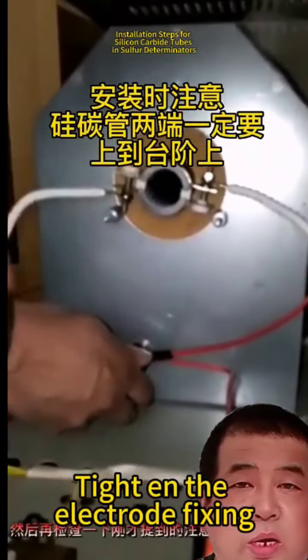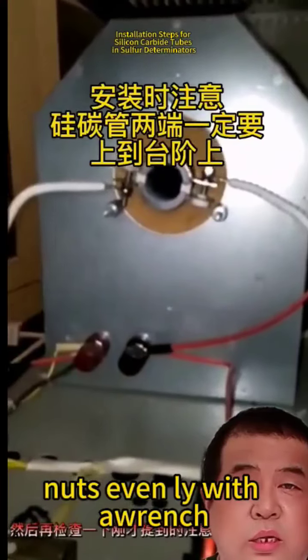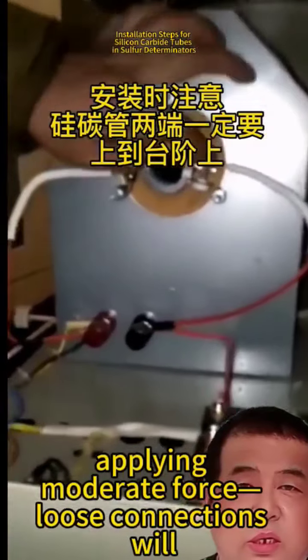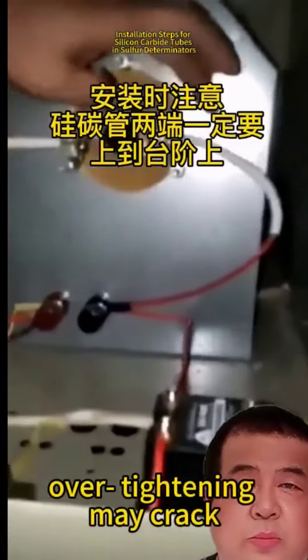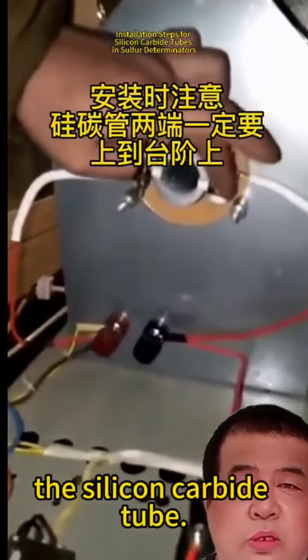Tighten the electrode fixing nuts evenly with a wrench, applying moderate force. Loose connections will lead to poor contact and electrical arcing. Over tightening may crack the silicon carbide tube.